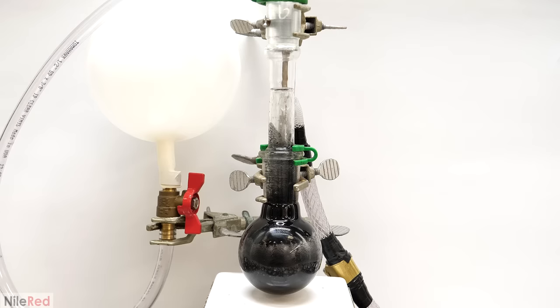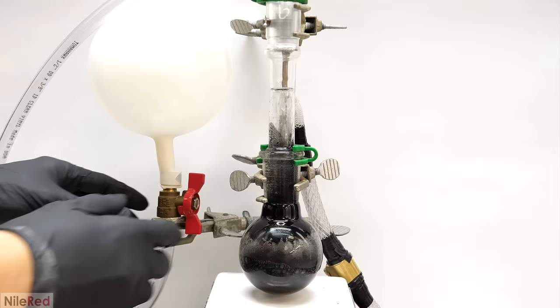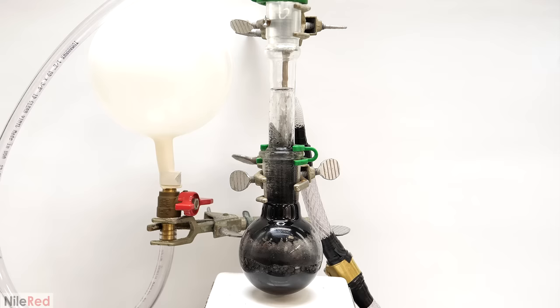Some hydrogenations generate a decent amount of heat but this one seemed relatively tame. There was no cooling or anything else that needed to be done and I just let it sit here until it stopped absorbing hydrogen. The way that I knew it reached this point was because the balloon stopped shrinking. This usually isn't the best way to judge it though because if there's any leak in the system it will seem like the reaction goes on forever.